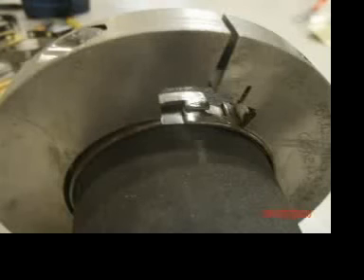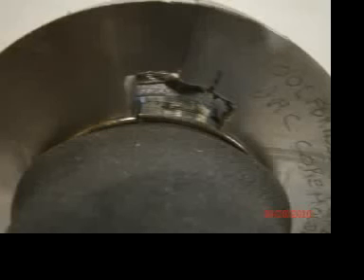Another interesting thing to note is that when you actually put it together and slide the shim on, you should have it in this position shown. This way you can slide the shim underneath it in the easiest place, and you will be able to compress the two ends together a lot easier. At this point, it's looking pretty good, and continuing to tighten the bolts on the fixture will bring the two ends closer and closer together.